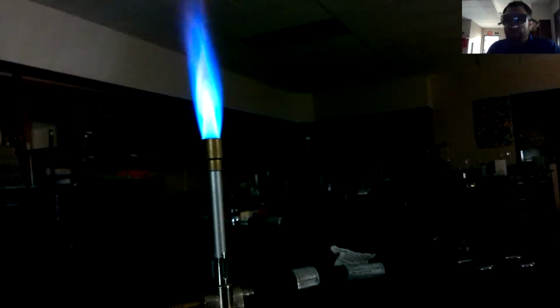is the reaction of magnesium with oxygen. So I've got that magnesium ribbon again. It's going to be tough to see. I've got the lights still off here, but I've got that magnesium ribbon. Now I'm not reacting magnesium with methane. I'm not reacting magnesium with fire. I'm just using fire to get it going. The only thing we're going to react, this is reaction number 6 here, and watch, because it happens quickly.